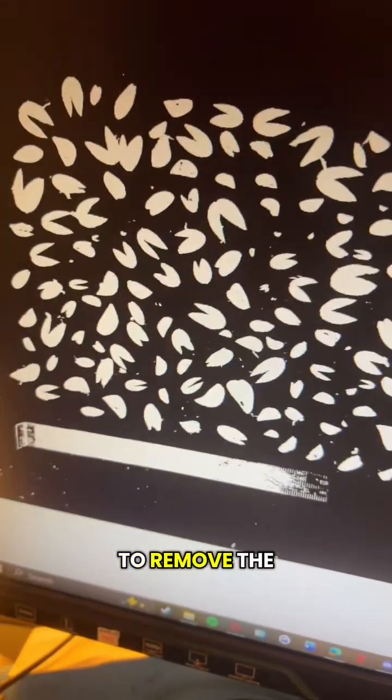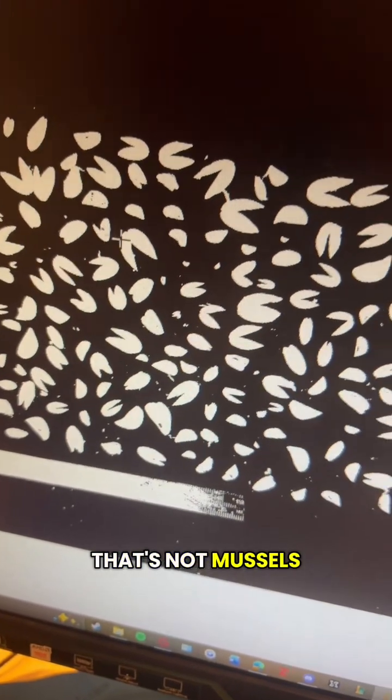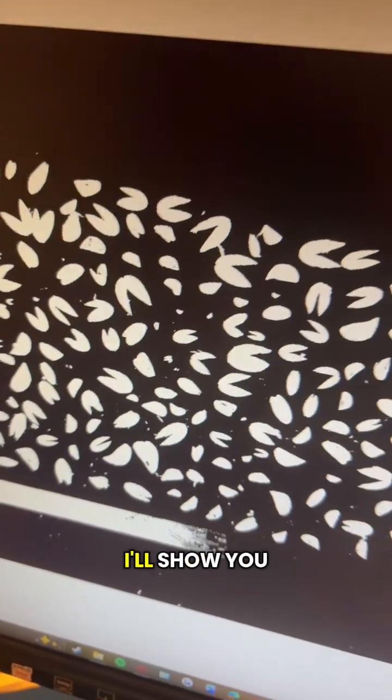So now we need to remove the ruler, and we need to remove all this other stuff that's not mussels. And that process actually takes quite a bit of time, so I'm just going to do it and I'll show you the final product. All right, so here's my final product.